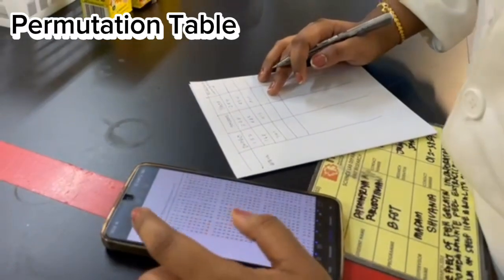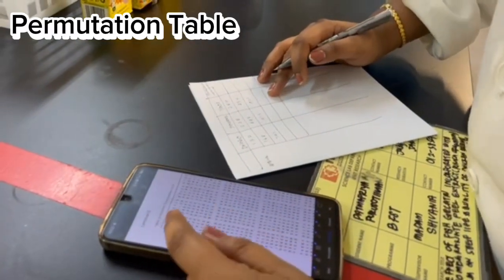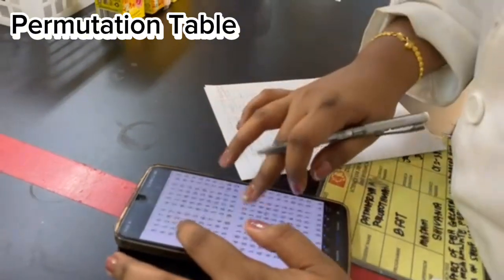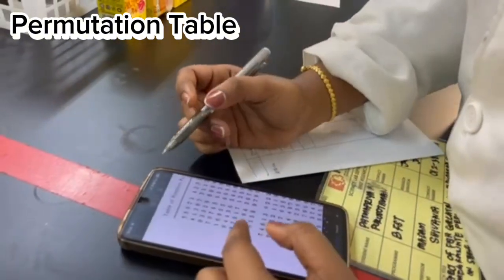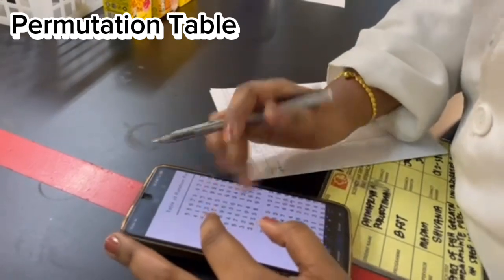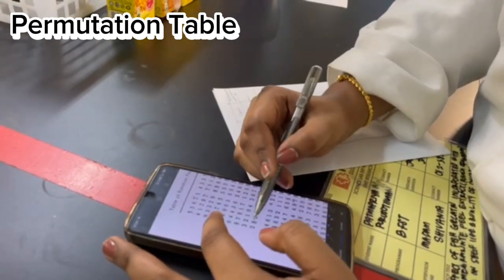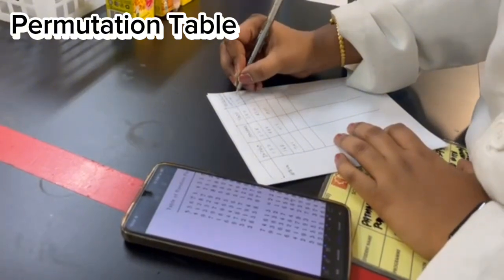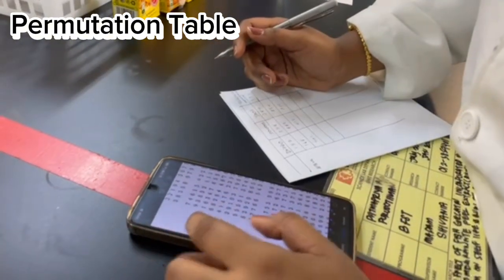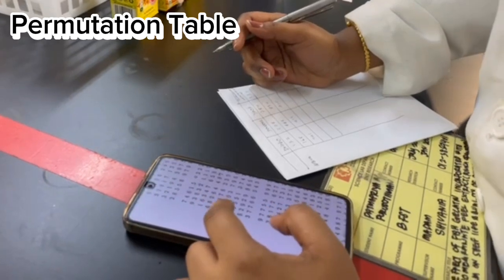Okay, now we are referring to the second table for permutation arrangement of the samples. For example, now we will take a look at this. As we can see, we have only 3 samples. We will go for numbers 1, 2, 3. So the arrangement will be 1, 3, 2. And then the next arrangement will be 1, 2, 3.